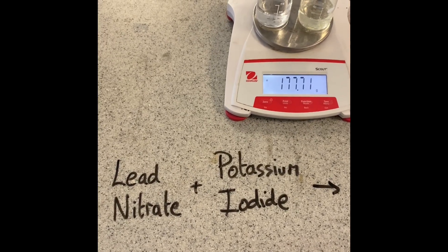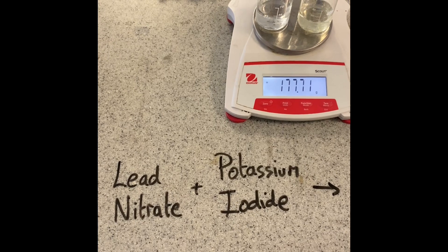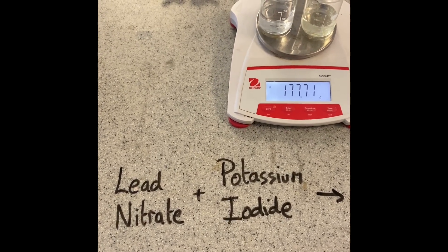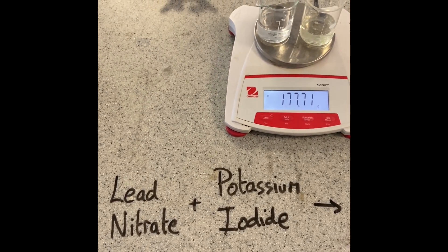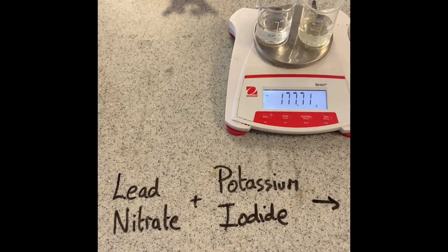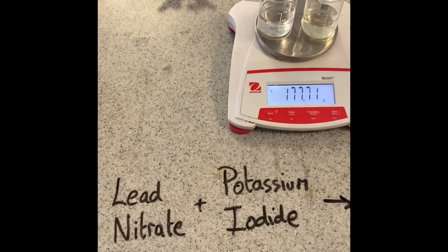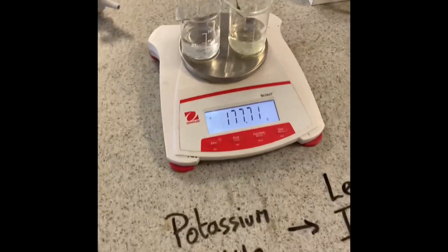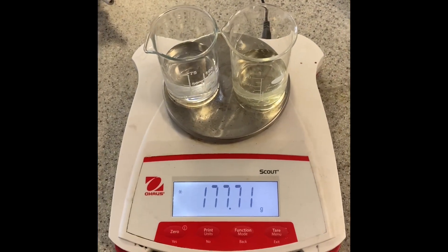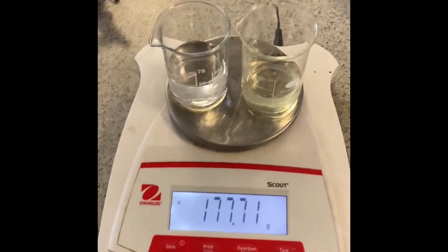Hello, so in this video I'm going to demonstrate a reaction between two solutions. So in our two beakers on the balance, one contains a solution of lead nitrate, the other contains a solution of potassium iodide. We can see those two beakers there sat on the balance, currently reading 177.71 grams.